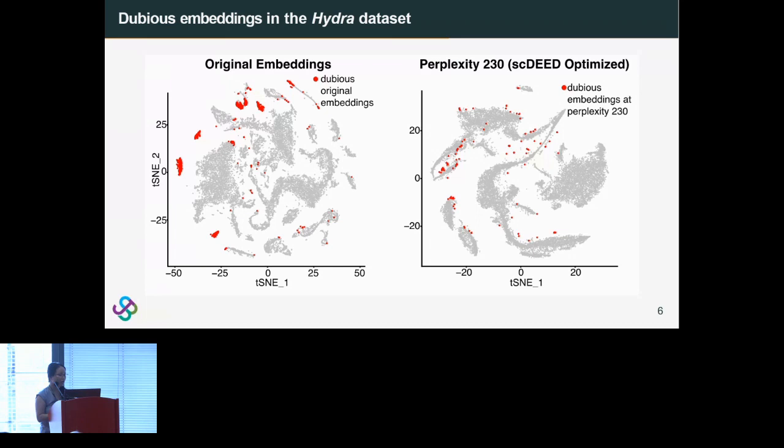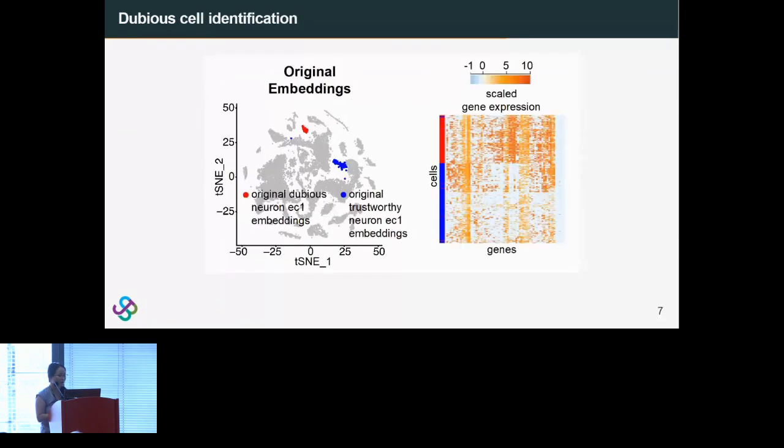cells. In the original embeddings, the neuron EC1 cells, which is one cell type, were split into two groups. We have the red cluster up at the top that was marked as dubious, and then a second cluster that was marked as trustworthy, that was separated. If we look at the gene expression between these two clusters, actually the gene expression is pretty similar. This, combined with the fact that the authors labeled this as only one cell type, really does suggest that there should not really be two clusters here. The separation into two clusters is not biologically meaningful, but just an artifact of the dimension reduction method.